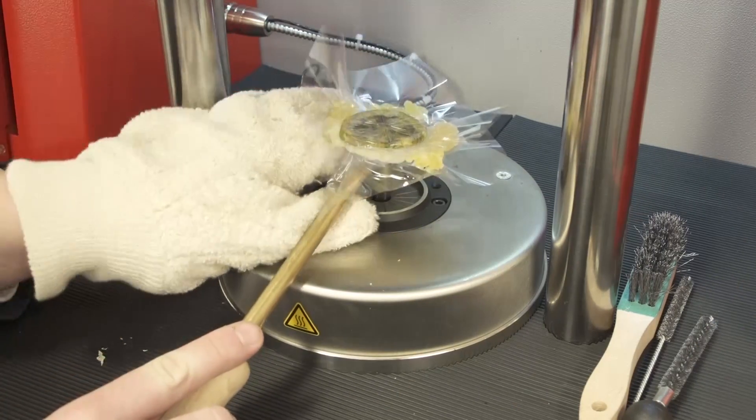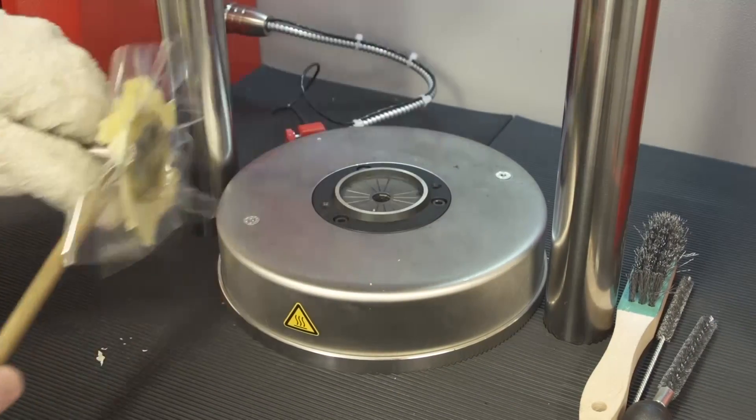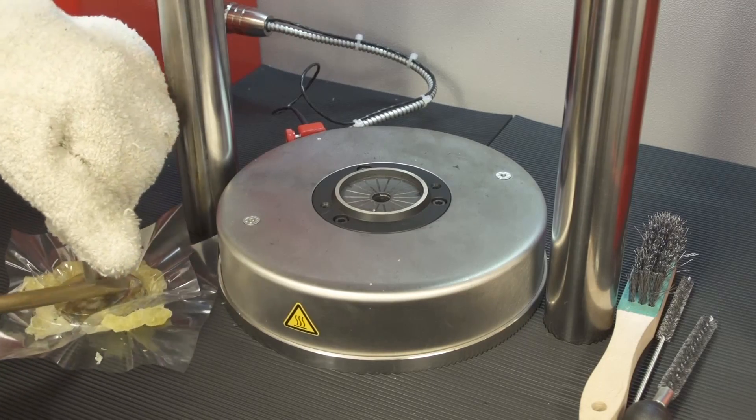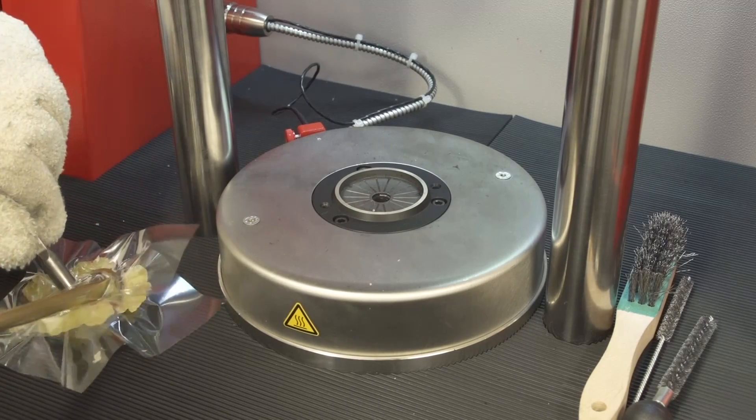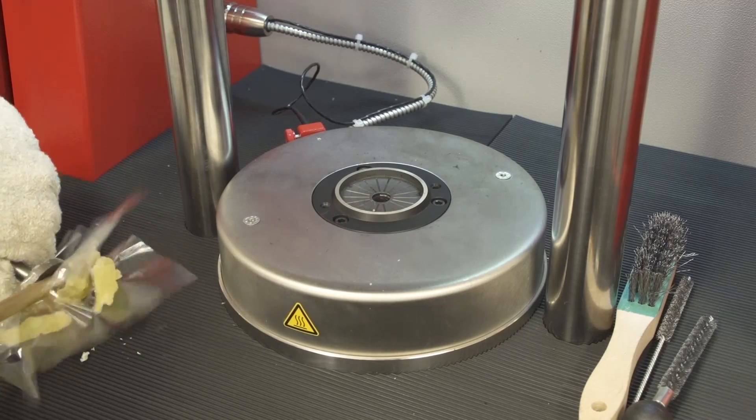Take the mounting lever, take out the rotor, and use the mounting lever to peel off the tested material from the rotor.